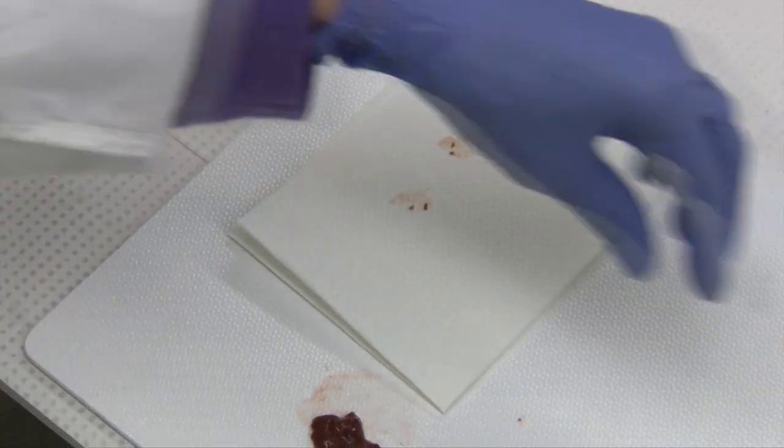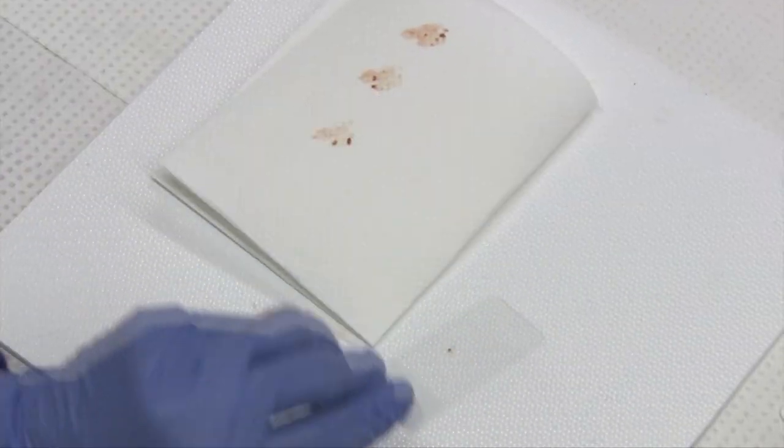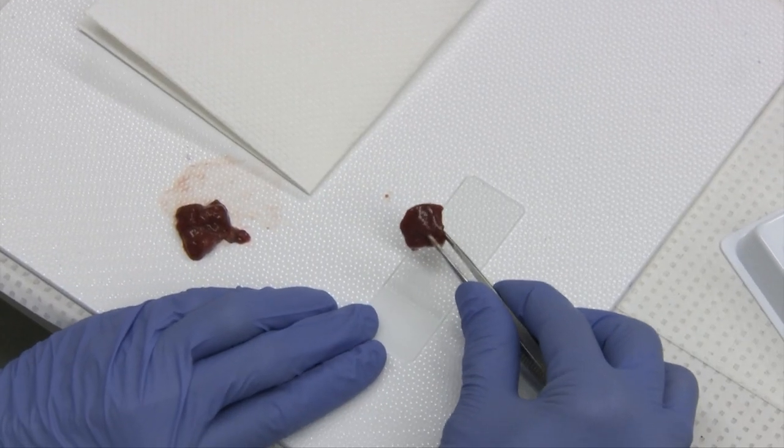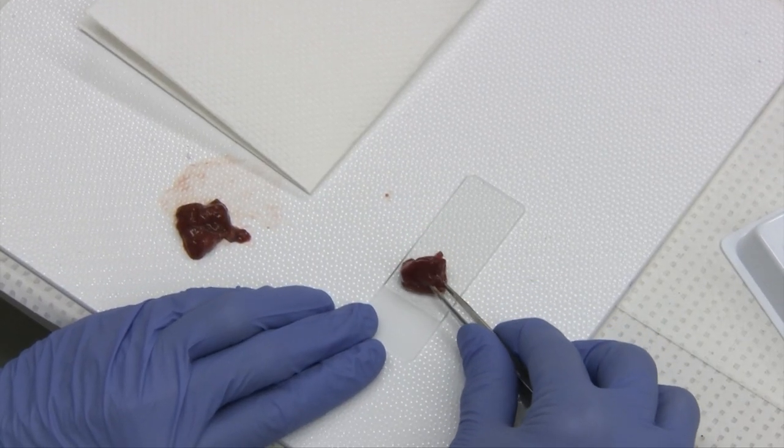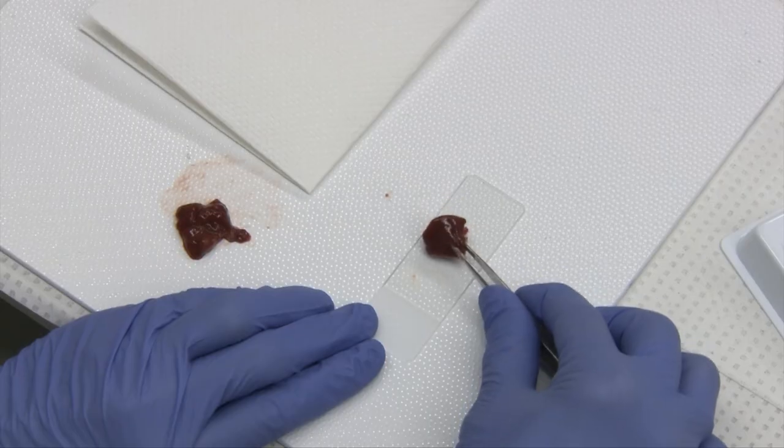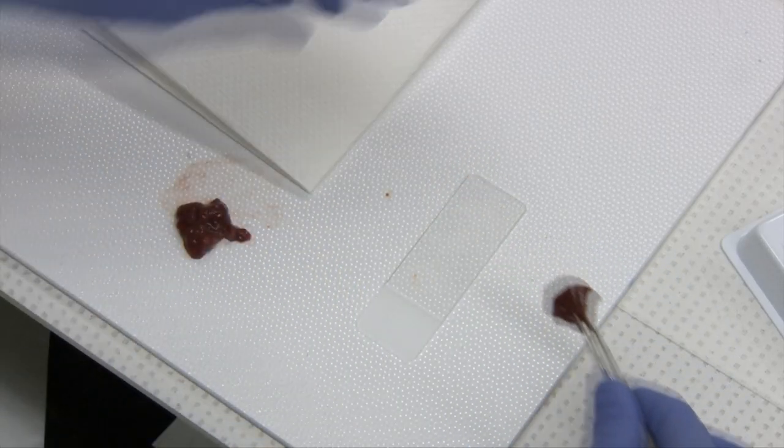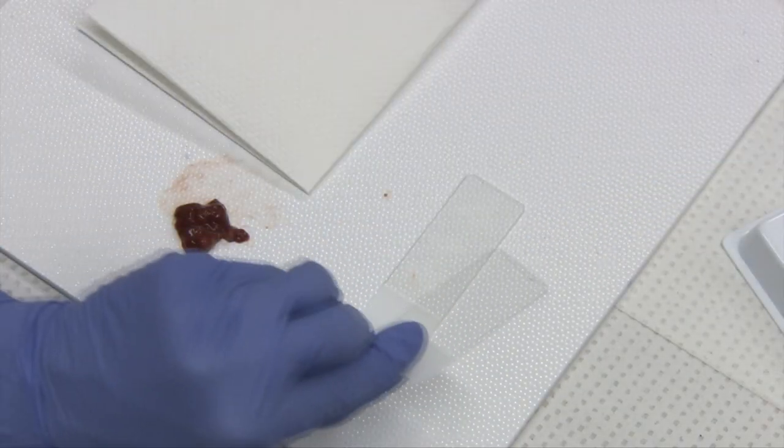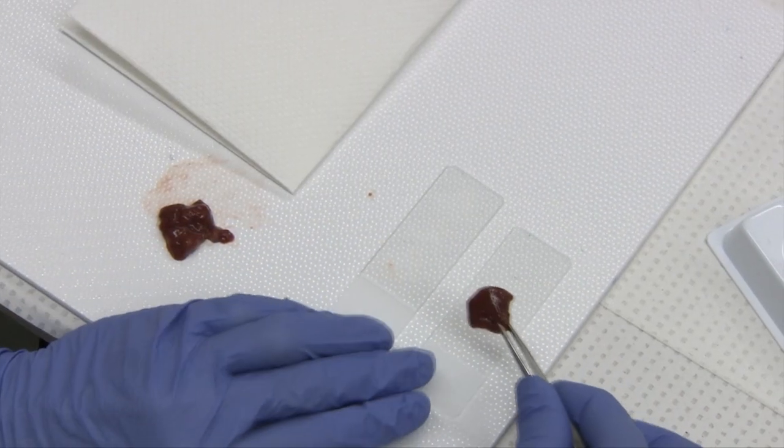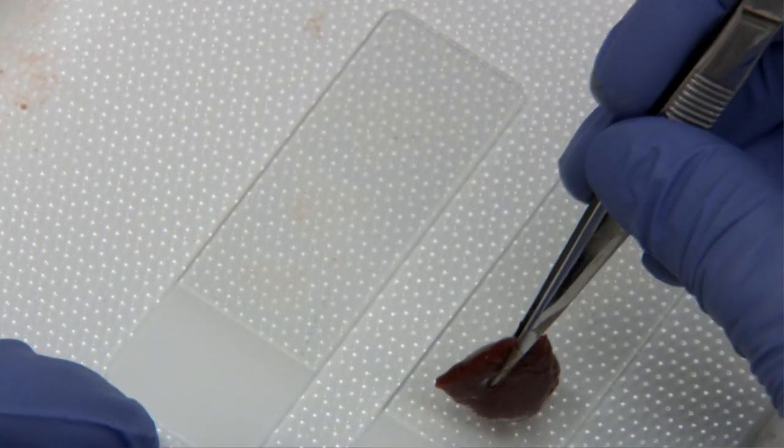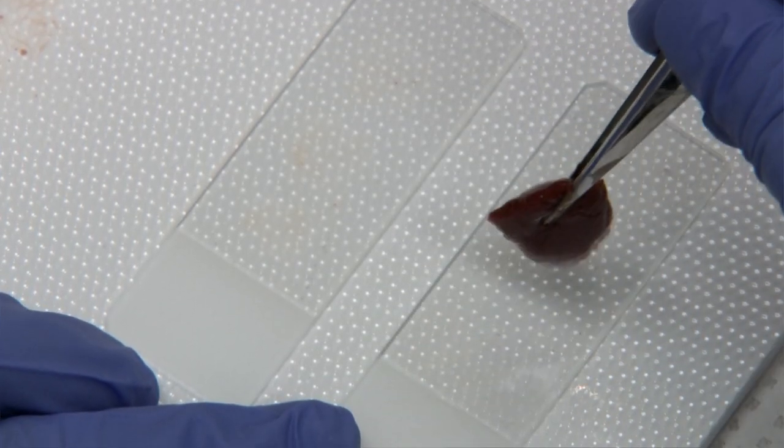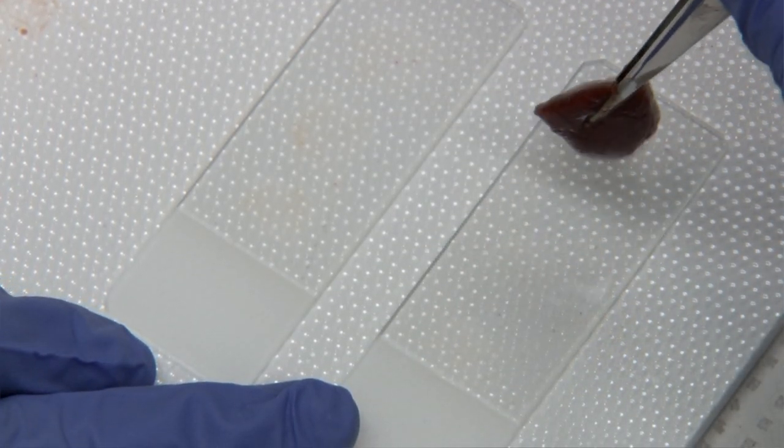Then we will take a slide and gently touch that same fresh edge to the slide. I have room to make about three impression smears on that slide. You can keep making two or three slides. I'll make two in this case, gently touching the tissue each time to that slide.